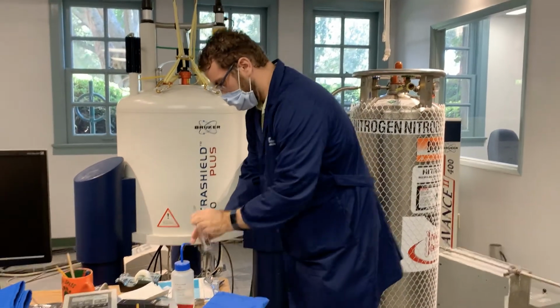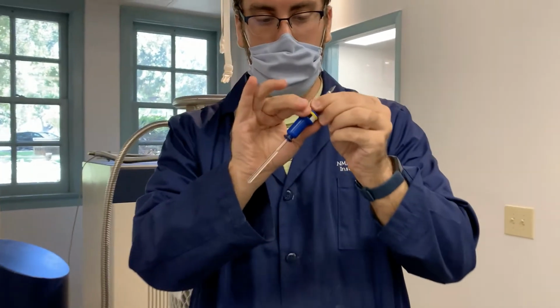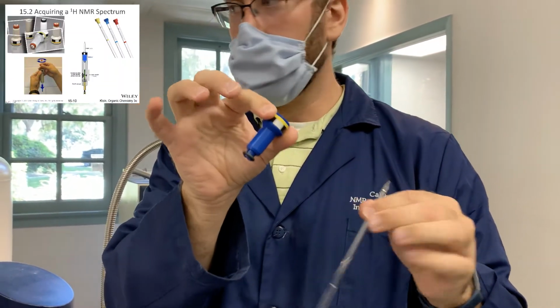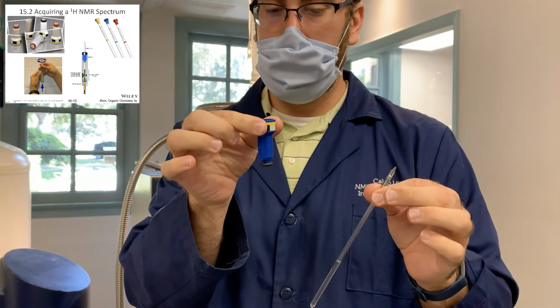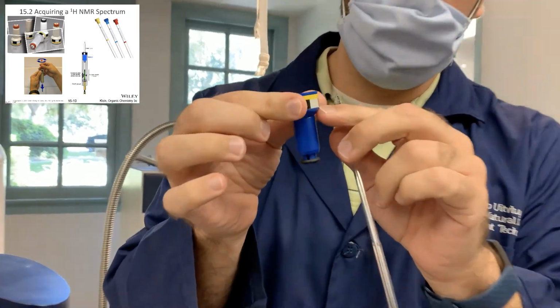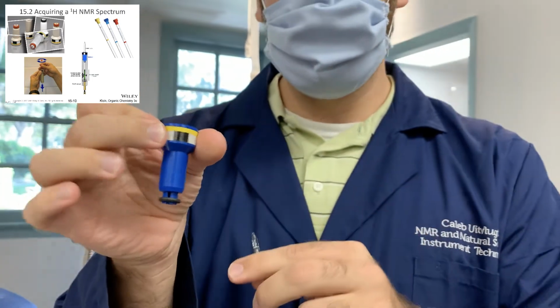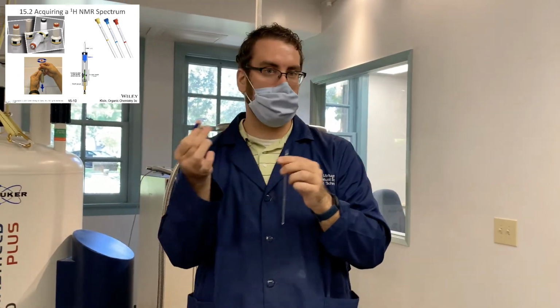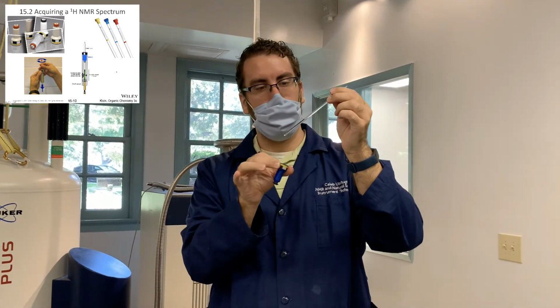So what does a sample look like? Well, right here, we have a little tube. So there are a couple parts. We have this little spinner guy. We use pneumatic air to put a sample in and out, and so this helps the air catch the sample. Also, you can see the black and white pattern around it. That's for if we're spinning a sample, it can tell how fast it's spinning based on a little laser checking that. And then we have the sample here filled with liquid.